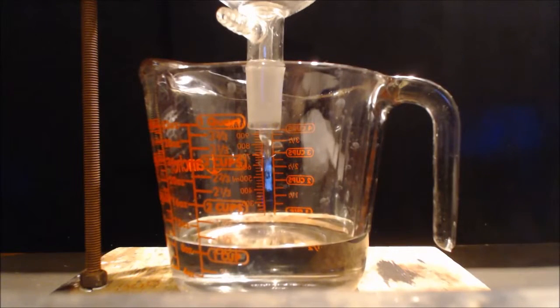Now, I boiled that and I could not get it to all dissolve, and I couldn't get it out with a paper filter. So I used a frit filter and it did a good job getting it out. I'm doing it a second time here, but I cleaned out the frit in between with some hydrochloric acid, and it was bubbling there too. So I don't know what that was. Maybe some carbonate was in there that was insoluble. So there I got it out.